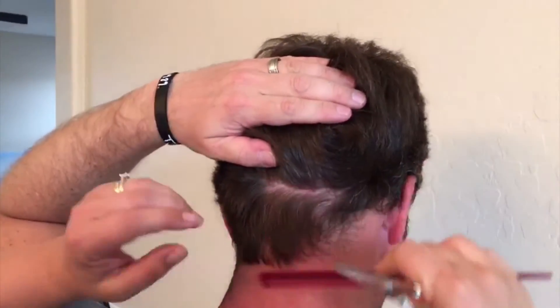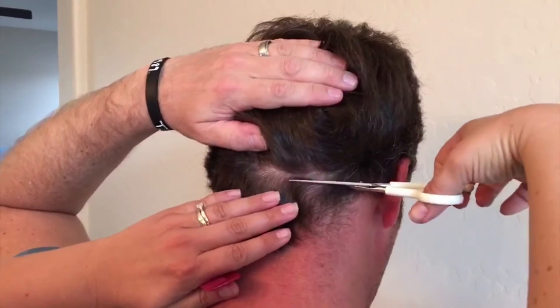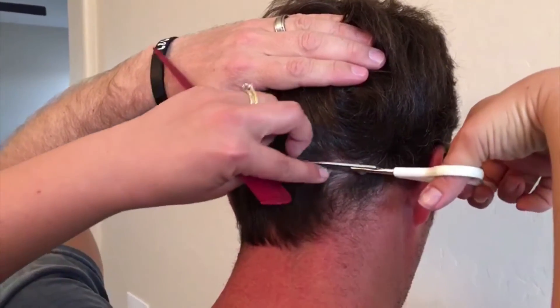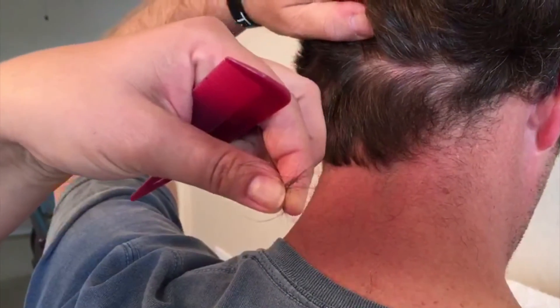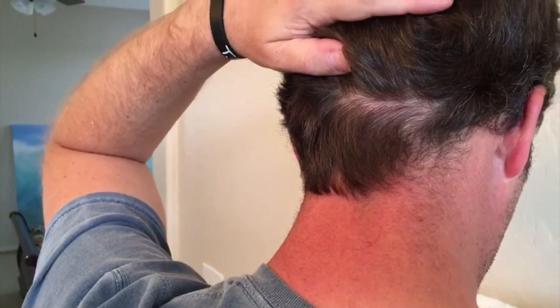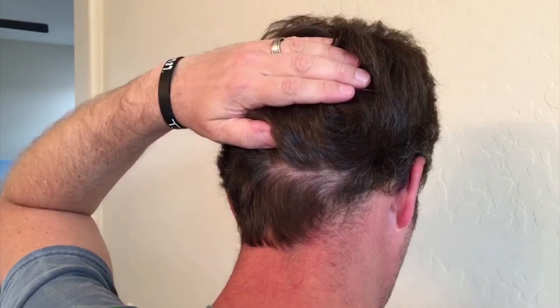Having the part here, we're going to start with the scissors and come in and collect a very narrow strip of hair that we're going to cut here at the scalp. I'm going to collect this as I cut it — there's just a very little amount of hair. I'm going to start collecting it on my scale, and we're going to repeat that several times.